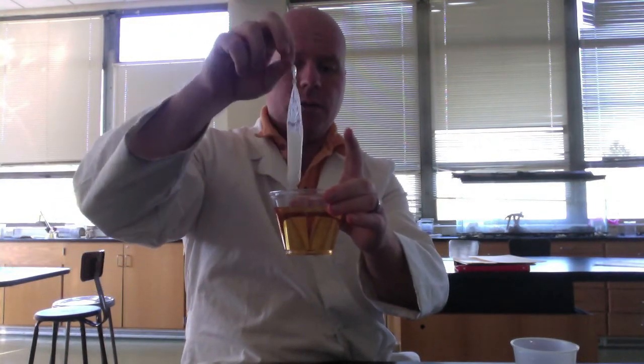Now I have an environment that we're going to soak it in. This is just distilled water, so there's nothing in there. And I'm just going to put a couple drops of iodine into the water. All right, mix that around. So it should be a nice pale yellow color. All right, so now we have that. I have our bag, and we're going to let this soak in here for a while, and I'll come back and show you what that looks like in a minute.